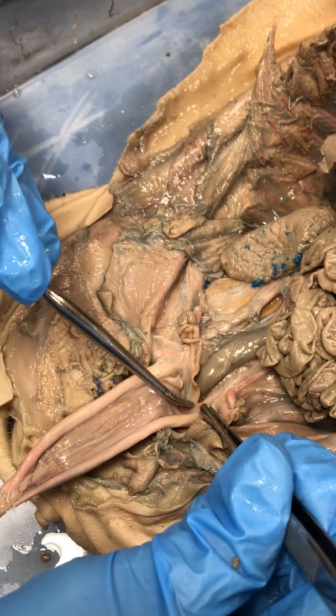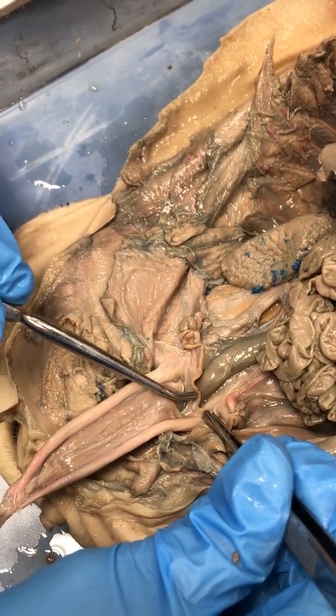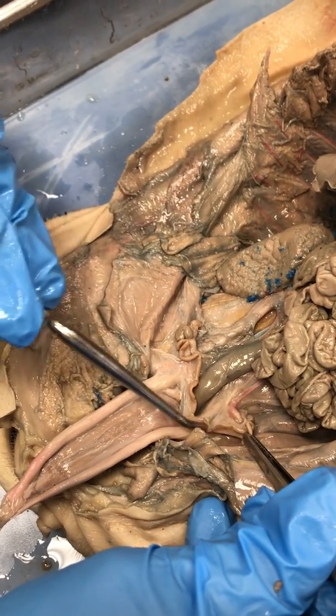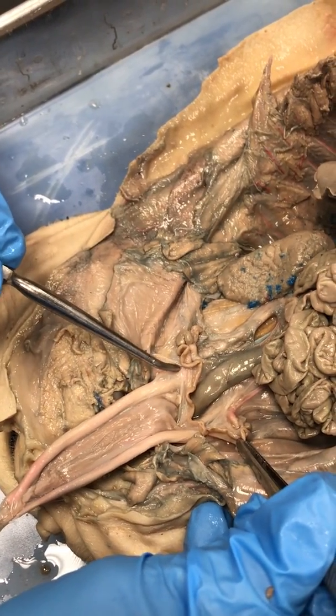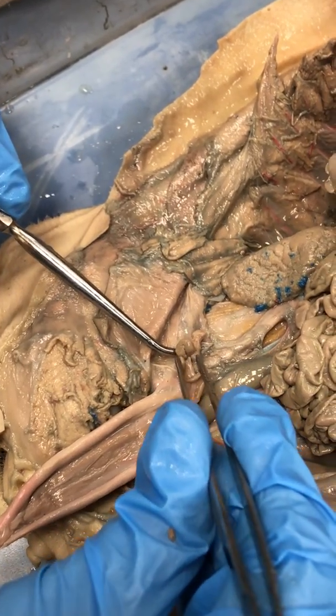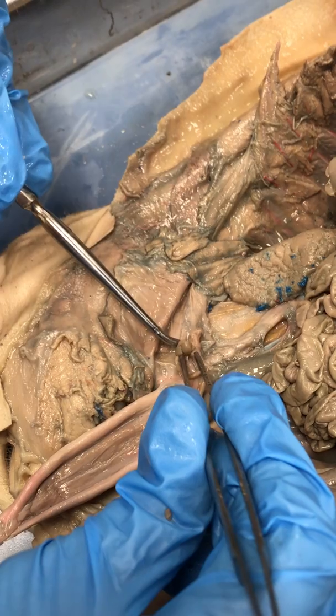Pigs, as well as most domestic mammals, have horns to their uteruses. If you pay attention, you can see a horn right here and then one that I'm gripping to hold the body up, a horn right here. Those are called your uterine horns. This leads you to this small little bean-like structure on either side. Those are going to be what?